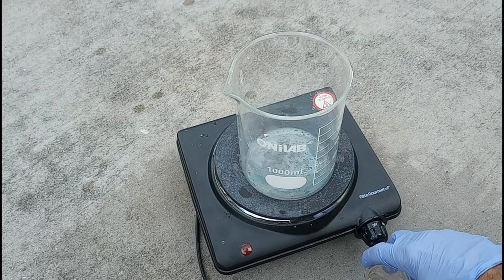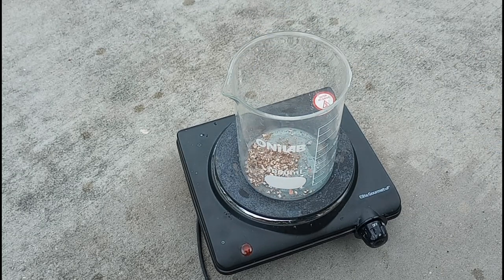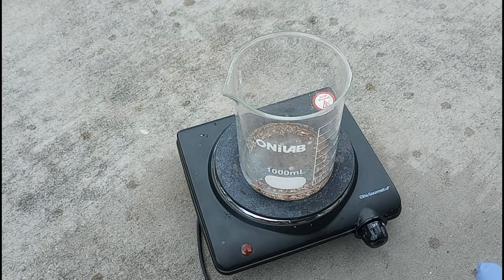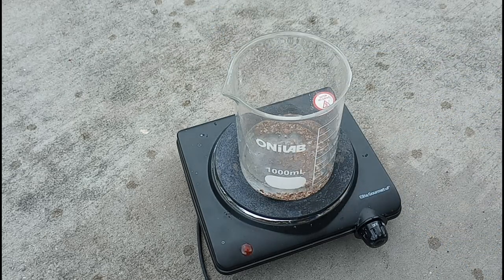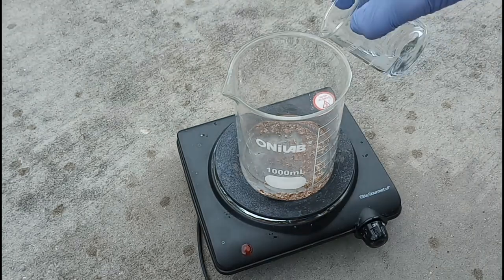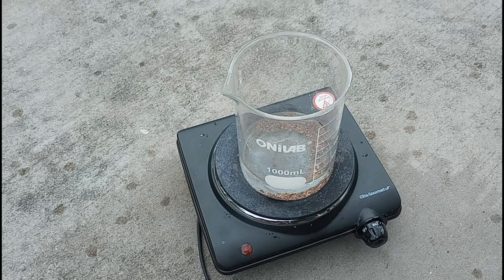That meant we had another total loss of two point seven eight one grams. So we're going to go back to dissolving again. We'll put in our brass pieces and then add two hundred milliliters of vinegar and another fifty milliliters of hydrogen peroxide, and right from the start we're going to crank the heat all the way up.